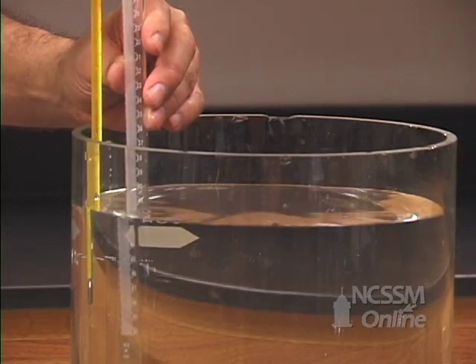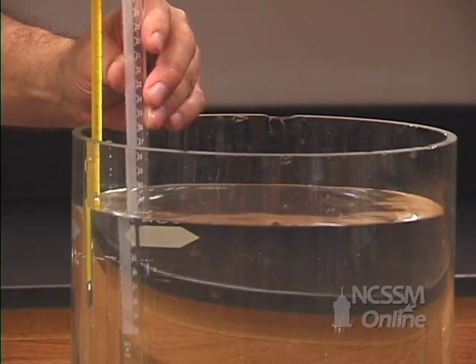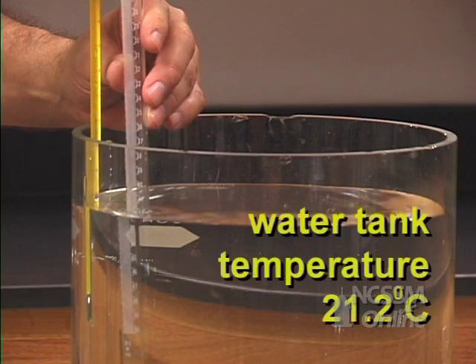We will correct for the pressure of the water vapor by measuring the temperature of the water in the water tank.